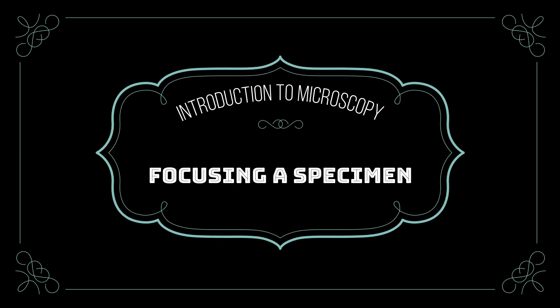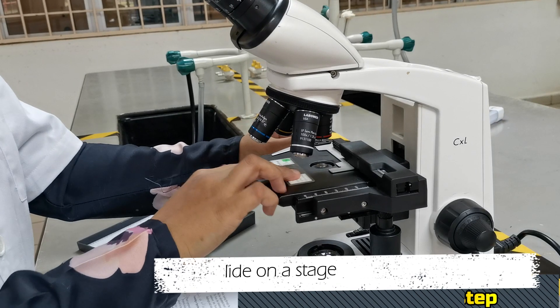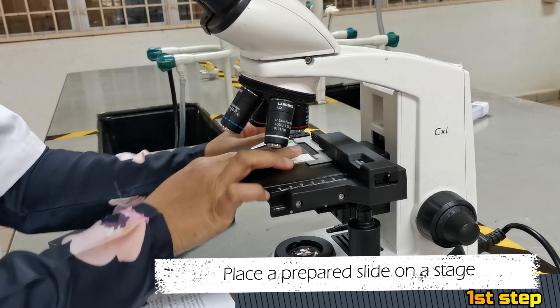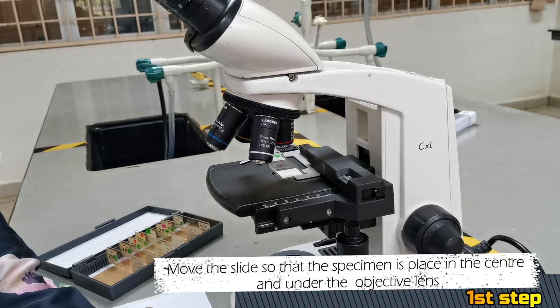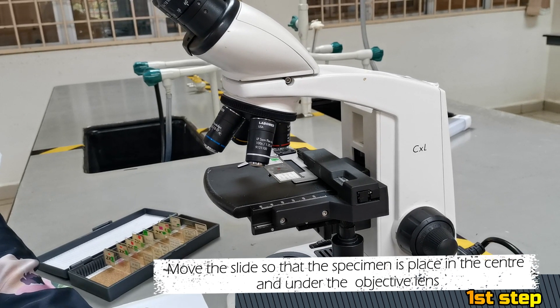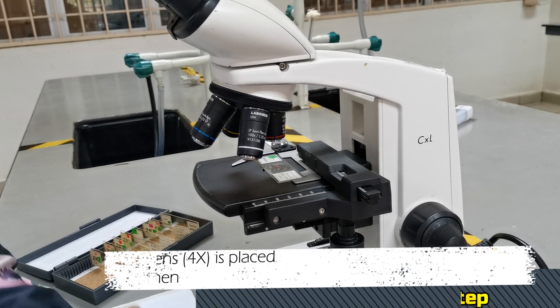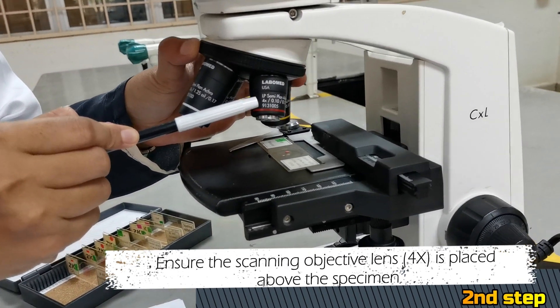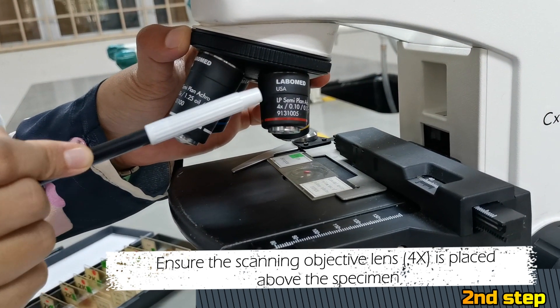Next, we will learn how to focus a specimen while using the microscope. First, place a prepared slide on the stage. Move the slide so the specimen is placed in the center and under the objective lens. Second, you need to ensure that the scanning objective lens, which is the 4x objective lens, is placed above the specimen.